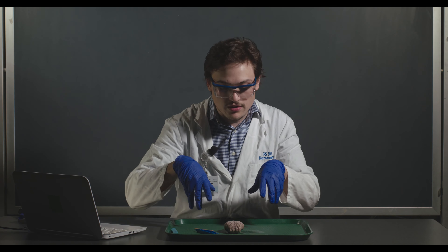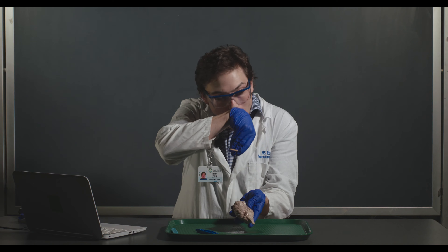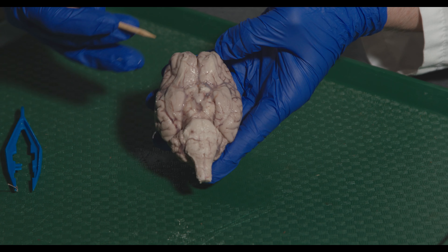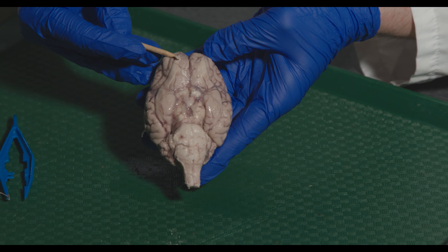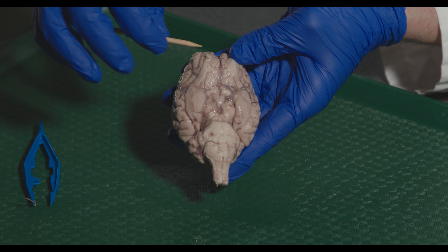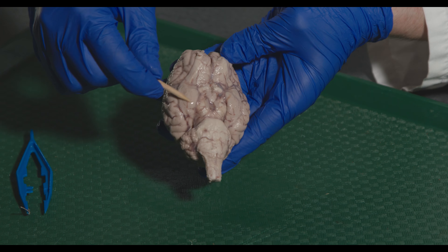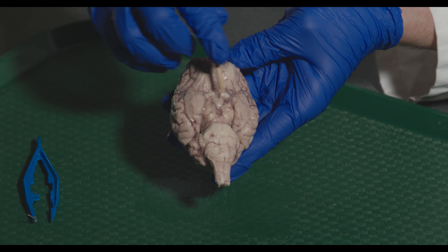Now I'm going to talk about some of the ventral structures by flipping the brain over. Some structures that we can see — though this brain is a bit mashed — are the olfactory bulbs. The olfactory nerve, or cranial nerve 1, actually comes out of the olfactory bulbs and goes into the nasal cavity. You can also see the olfactory tract, which comes down into what's going to be the piriform cortex. This region is referred to as the uncus, and the amygdala is in there.